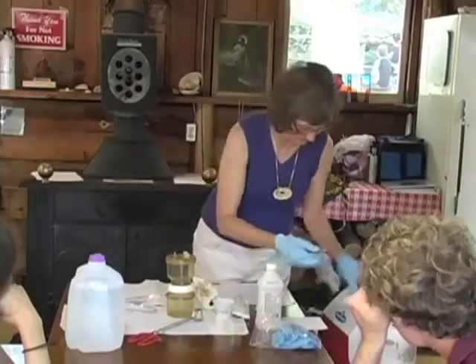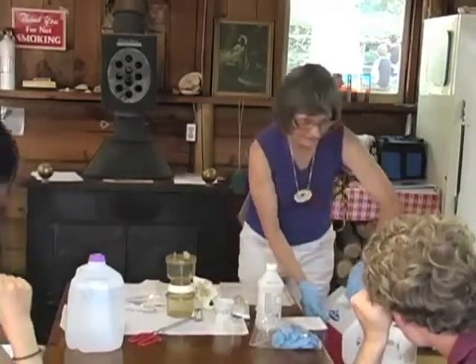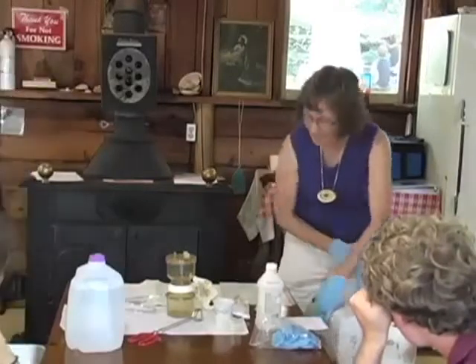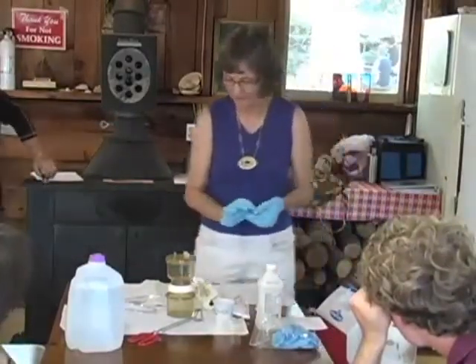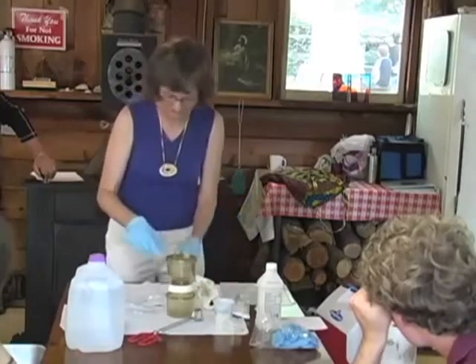But we have more stuff. We'll just better the nutrient broth than the salad. Yes, exactly, amen to that. And there was nothing, I mean, everything was closed in, so there was no danger to our food, but normally you would want to have a lab fridge or something.